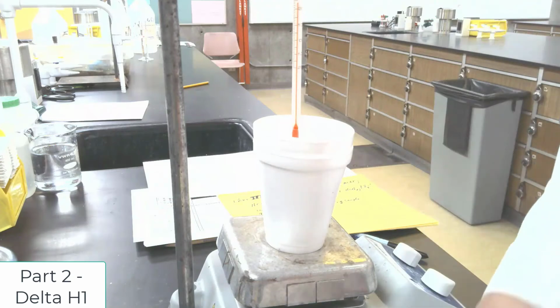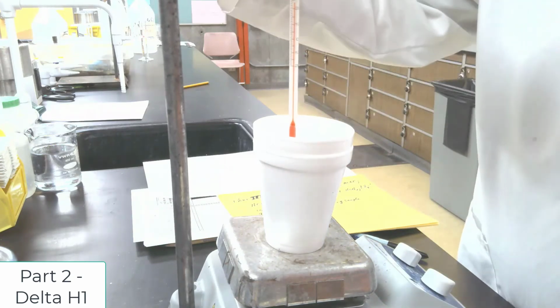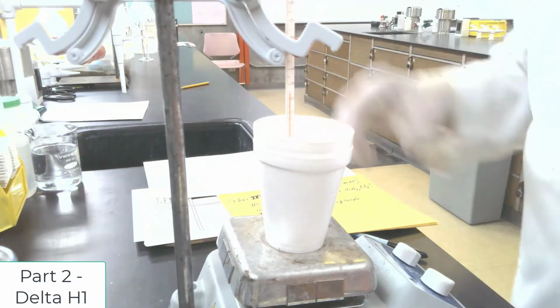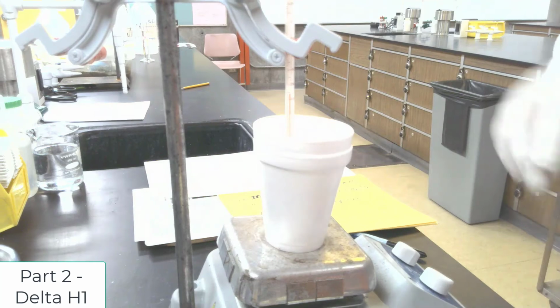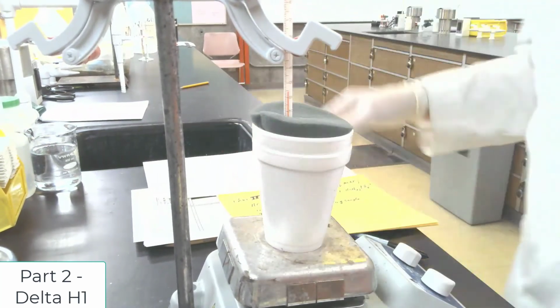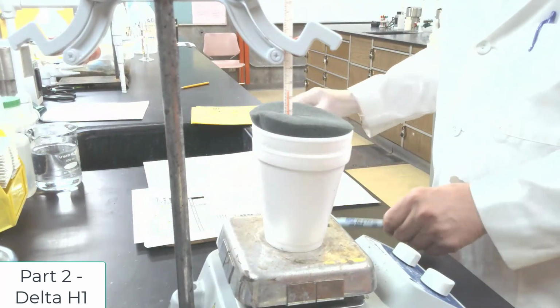So I've added my 3 grams to that 100 mils. I will lower my thermometer into the liquid, and while it's stirring, I'll put the cover on to keep it from losing energy, and I'll record the data every 30 seconds.